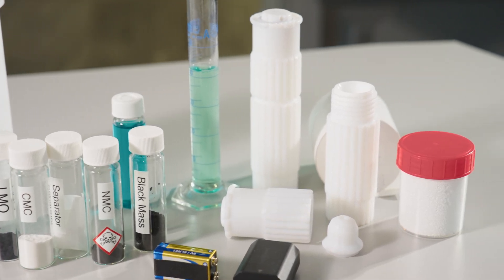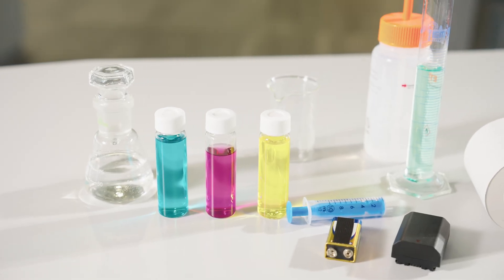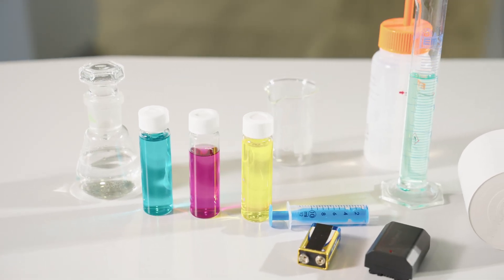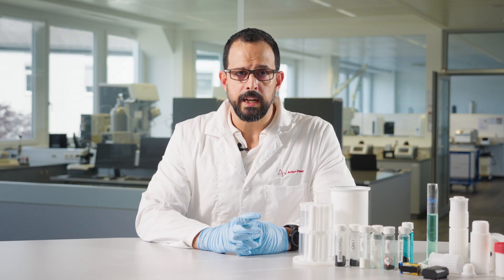These types of analytical instruments cannot measure elements directly. They need the sample to be in a liquid form, as a sample solution. This process of sample preparation for further trace element analysis is called acid digestion. It involves acids and heat to convert solid samples into solutions. This is a crucial step that can greatly affect the analysis results.